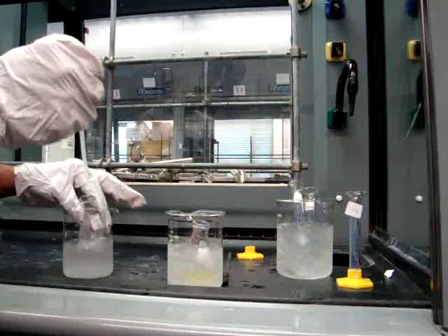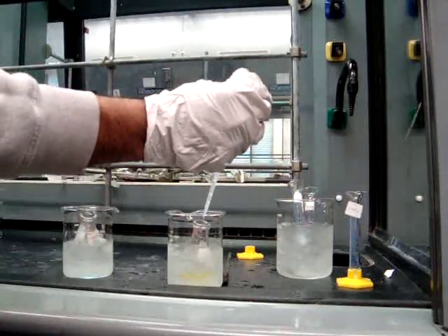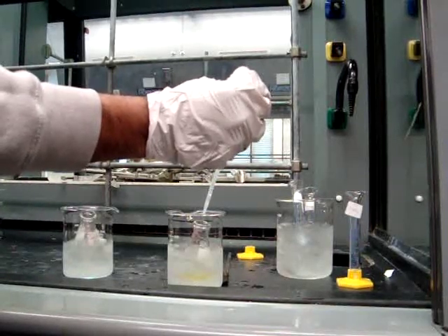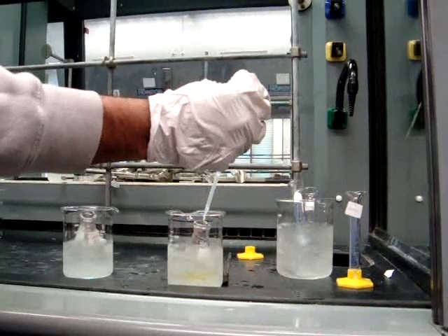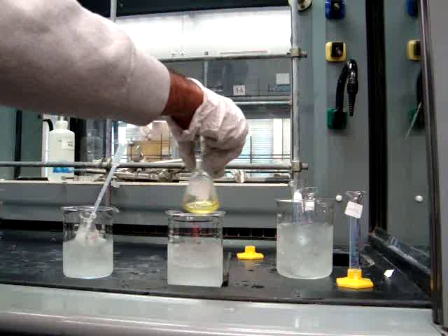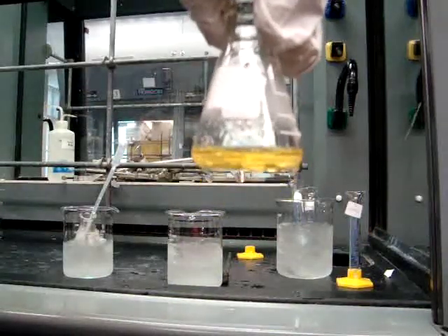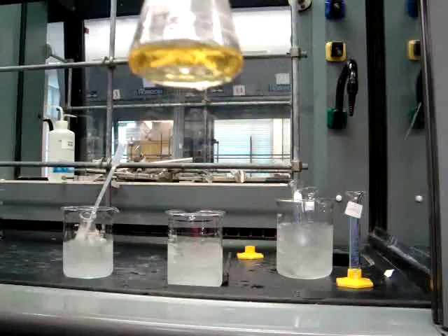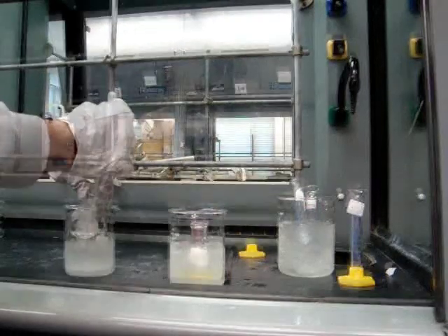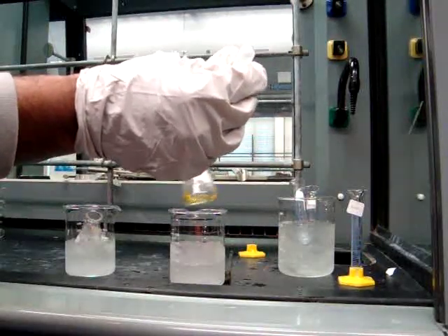Also, you can see that the mixture changes the color of the reaction. Make sure to note any important observations in your lab notebook. The color that you will observe is quite normal since the methyl benzoate is being nitrated.